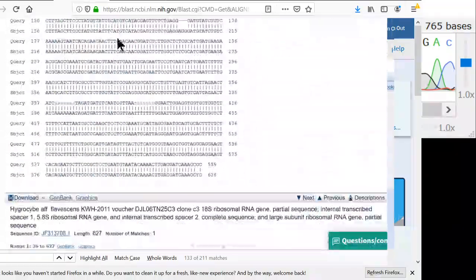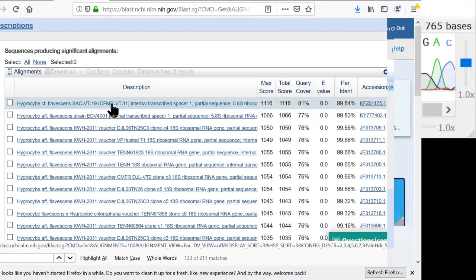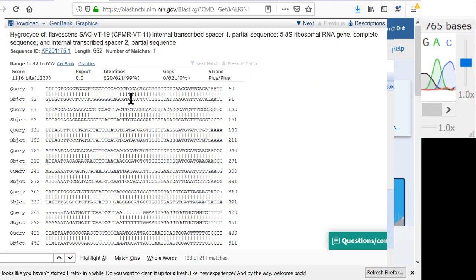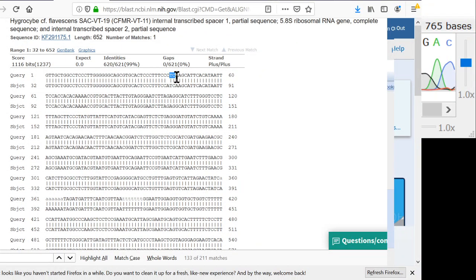So I think what we'll do to verify our sequence is just look at the top match there. Knowing that the query coverage is only 81%, 620 out of 621 bases are exactly the same. So that means there's only one difference, and here it is. I have a C where they have an A. So what I should do is check that spot in my chromatogram and see what exactly was going on there. See if that's some kind of sequencer error, or maybe there's a bunch of copies of the ITS gene in the genome and they're not all aligned. But I want to check that and see what that looks like in the chromatogram.